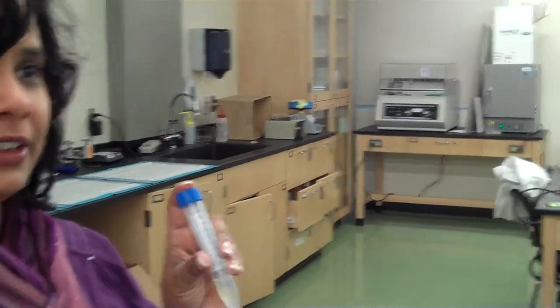Now, same kind of question: you want to get 1.5 milliliters out of here, and you have a pipetter that only does 1,000. What's the easiest way to solve that? 750 twice. 750 twice, mm-hmm. Right? This may seem like, who cares? You could do 1,000 and then 500 when you're doing one tube, but when you're working with a lot of samples, having to adjust your pipetter each time would get to be a real pain, which is why you want to develop these little tricks for doing things efficiently. Does that all make sense?